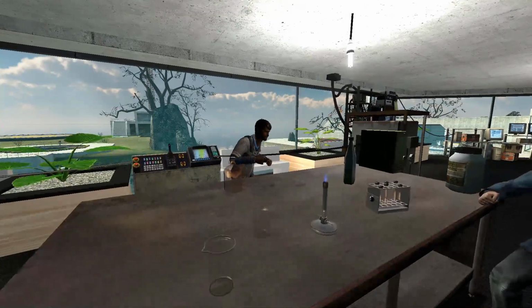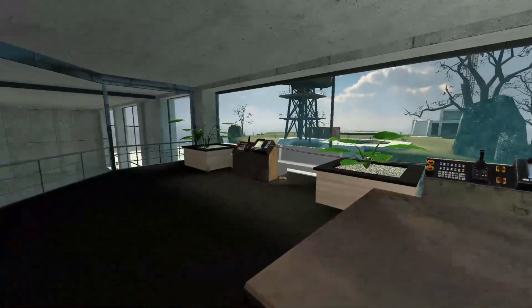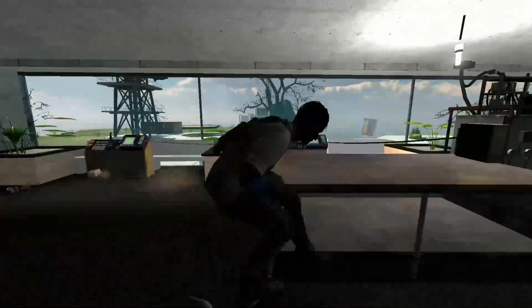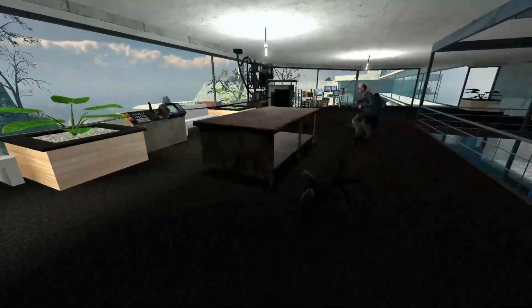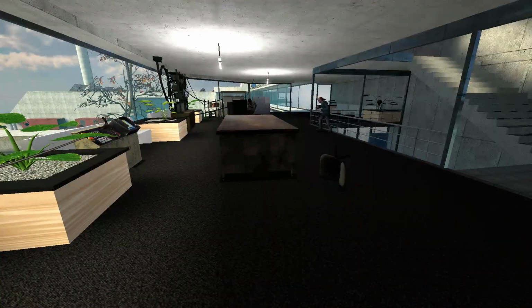Alright. You changed into your lab coat. We need to start working. Okay. Wait, what are you doing? You just broke the... What are you doing? Gabe, stop. You need to get fired. We'll fire you. Gabe. Ow. Come on, now we gotta clean up this glass. Come on, man. Dude, I stepped on some glass.